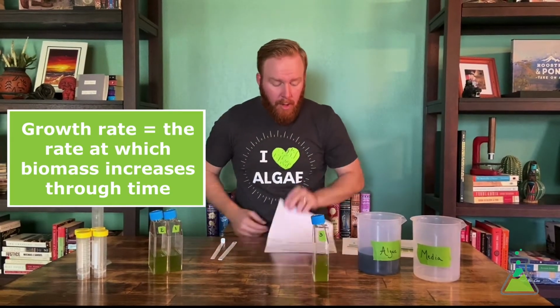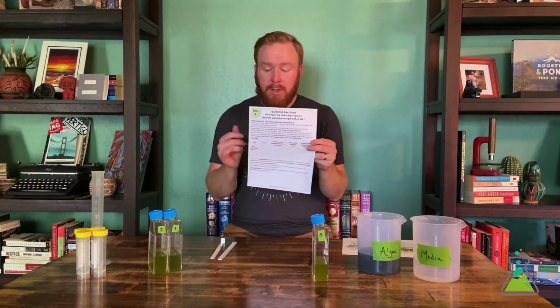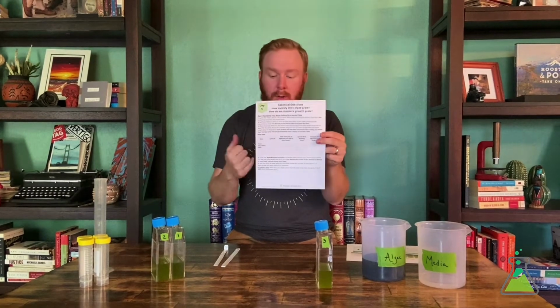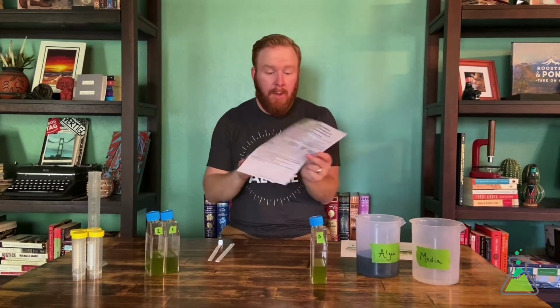So if you want to follow along with me here, it's the day 4 worksheet. On the top, it should say part 1, sampling your algae culture for a second time. There's a table here in the middle. The middle line here is from your day 2 data. So you can go ahead and insert that if you have that from previously. If not, we'll talk it through in a second as well. And then we also have this bottom line, which we're going to fill out today for day 4.